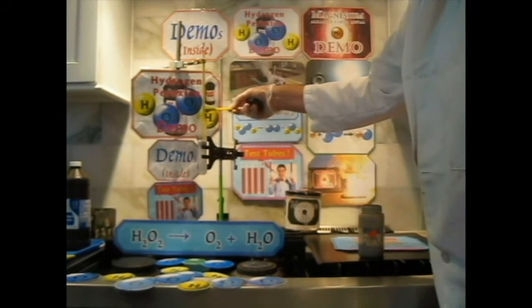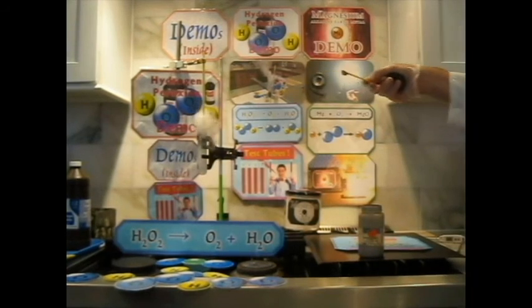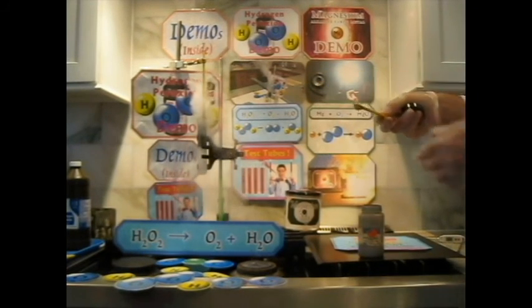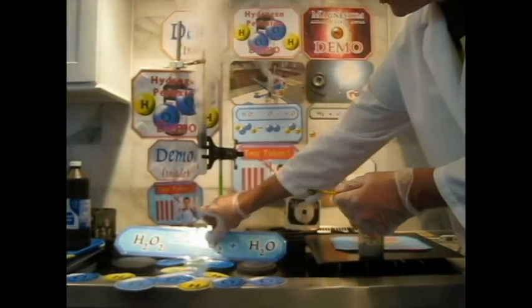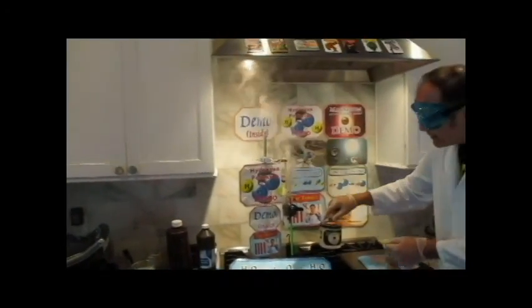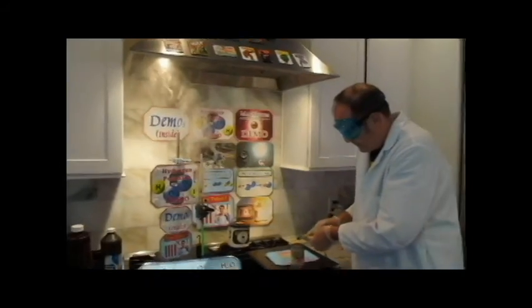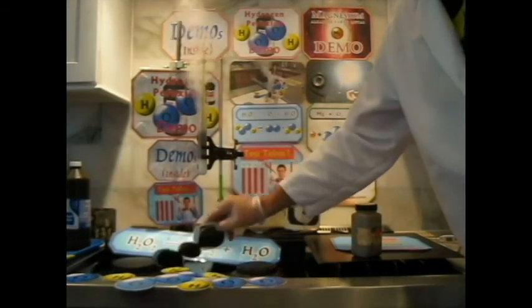So I'm going to add more now. That's not enough. I'm going to put more of the scoop in, and we're going to see this reaction speed up. So now notice, this is the reaction. We're producing oxygen and water. So maybe some of that is water vapor, but actually you can't see water vapor either. You're seeing it when it turns back into liquid. So what's the temperature on here? Well, now it's getting up to 30. It's rising. It's like going up, bouncing. Is that a pretty good reaction? It's like bouncing. And it's splattering a bit. This always happens with this reaction.